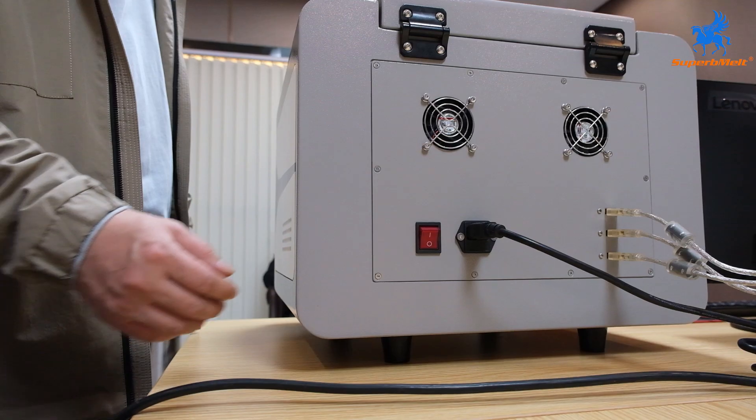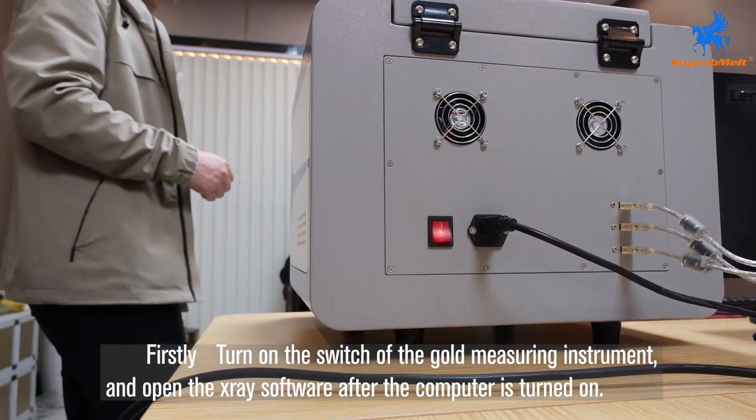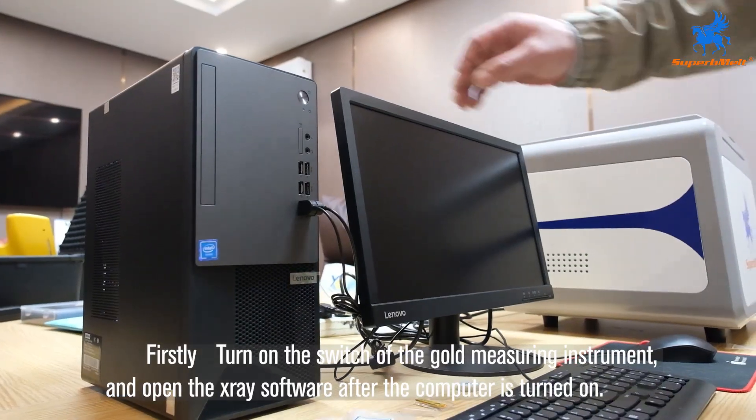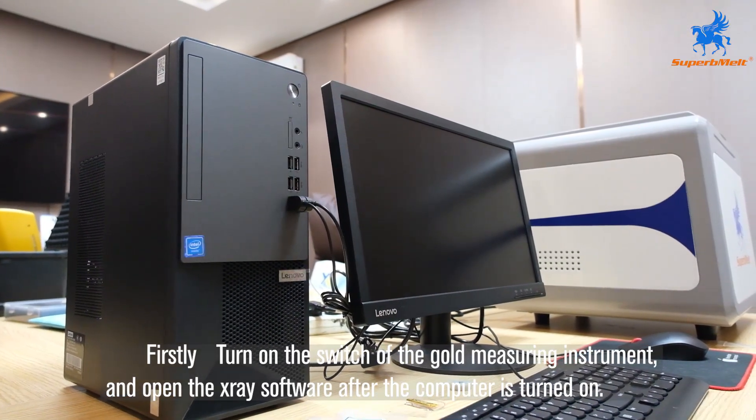Let us check the XRF analysis process. Firstly, turn on the switch of the gold measuring instrument and open the X-ray software after the computer is turned on.